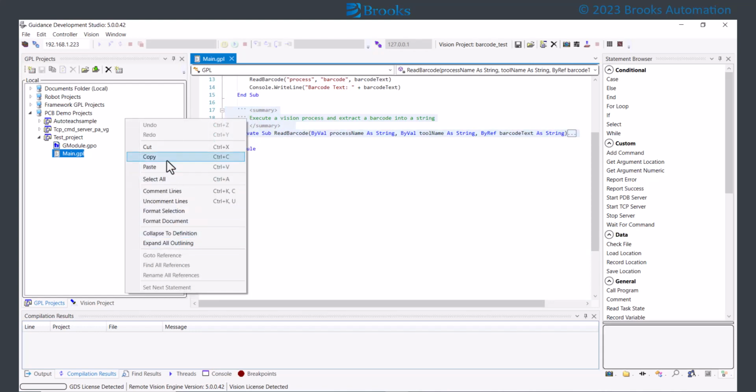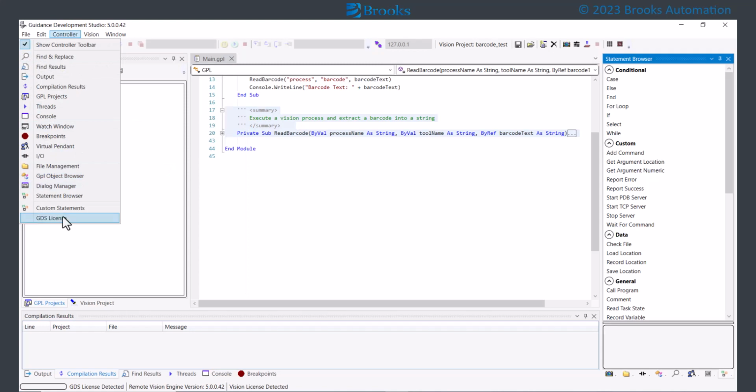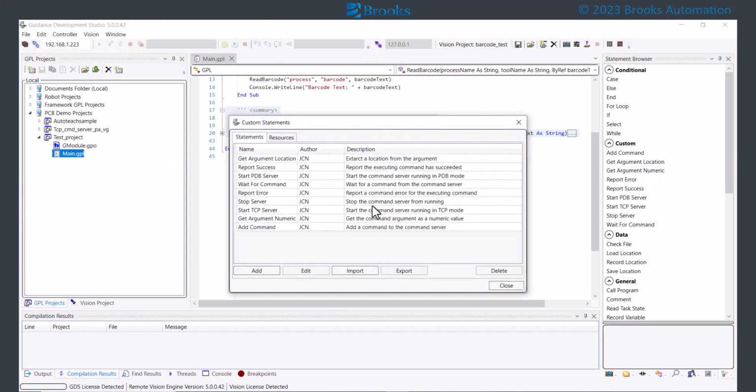Once it behaves correctly, we can package the program as a custom statement by accessing the Custom Statements option under the Controller pull-down menu. There are 2 distinct steps when creating a custom statement. The first is defining a resource that contains the function or subroutine that implements your logic. When a sequence is generating GPL code, it scans all statements and looks at which resources are required for the statements. It will ensure the resource is added to the generated GPL code.